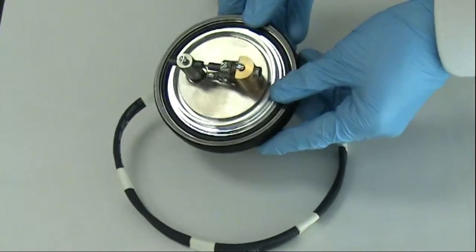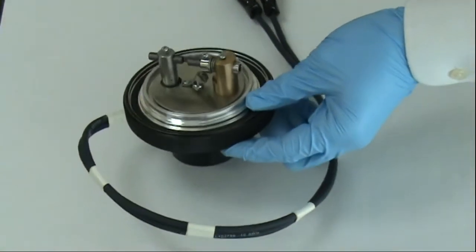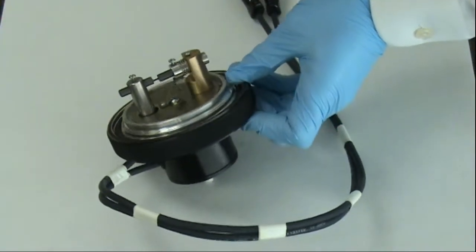After a final cleaning using an SPI easy duster, the rod head can now be placed back into position ready for the next coating cycle.